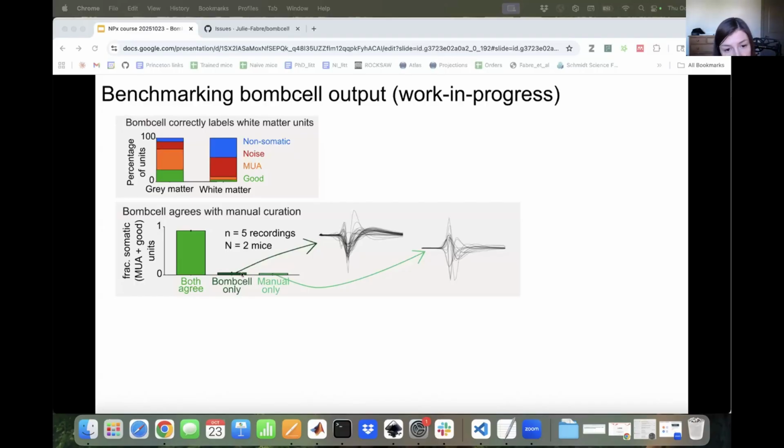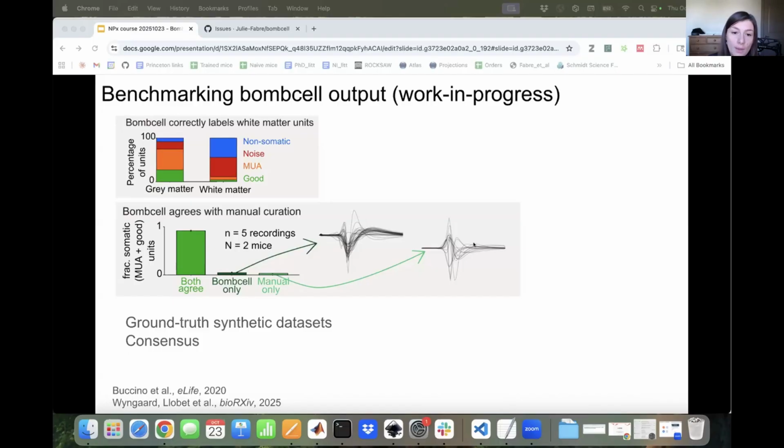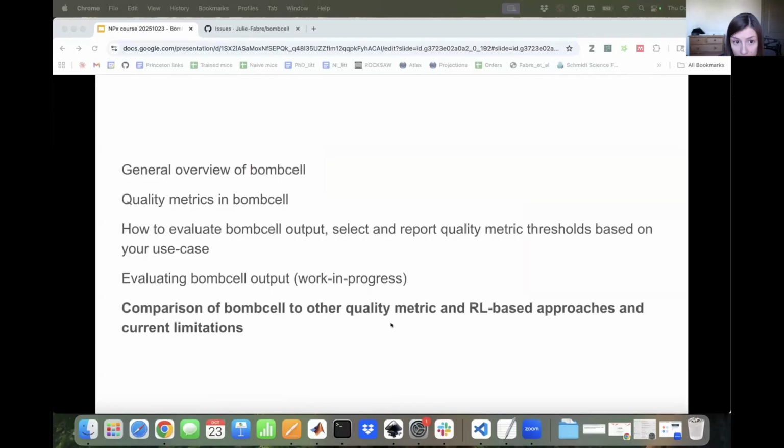And actually, interestingly, in the cases where they disagree, so here are all the waveforms where Bombcell decided this was actually a good unit. And if you look at them, they mostly seem pretty good to me. And when you look at the units where manual users actually decided these were good units, it seems more variable. So it seems like potentially they are in quite good concordance, and it's just somewhat errors in manual curation, because it is really hard to manually curate your data set and go through so many units. But I think really what will be important going forward is actually having ground truth synthetic data sets and comparing to this to actually properly benchmark.